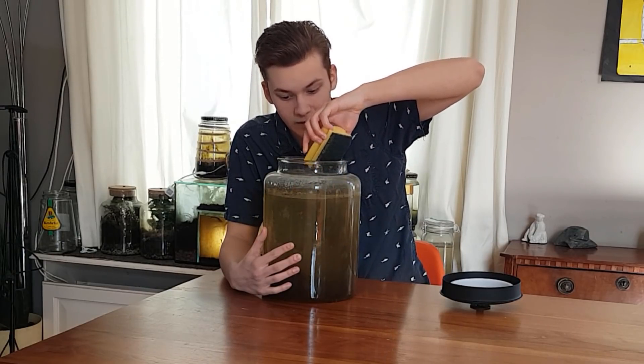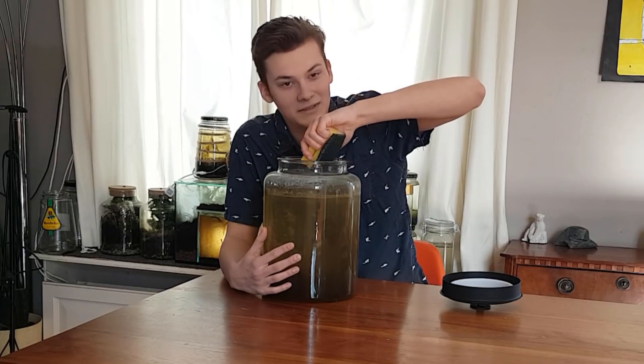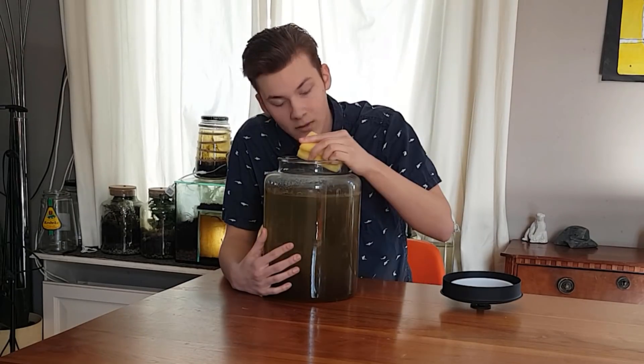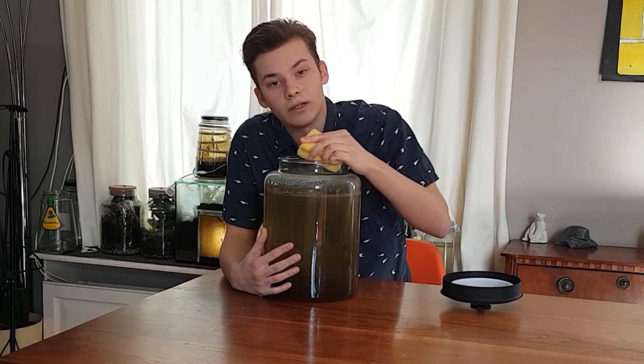Except it's all completely dead inside. Anyway, I'll get back to you when it's all clean.